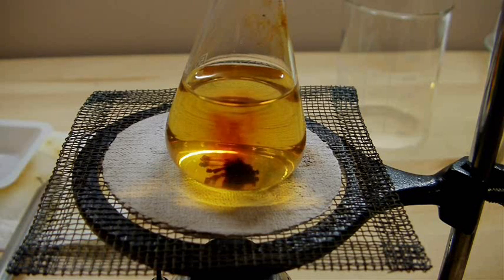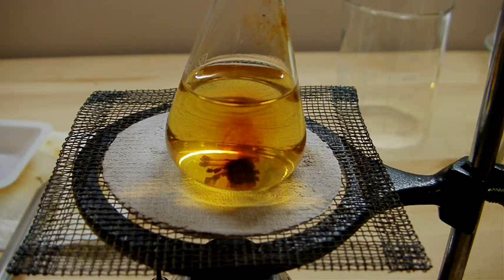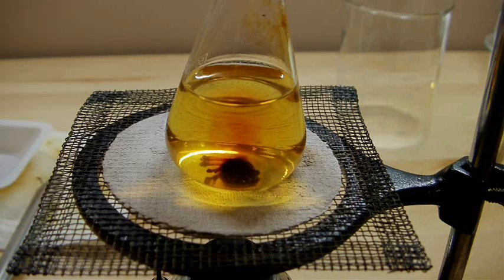If I have calculated and measured everything correctly, this color should totally disappear as all of the iodine is used up.